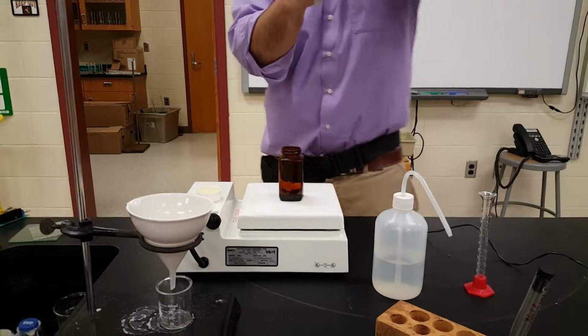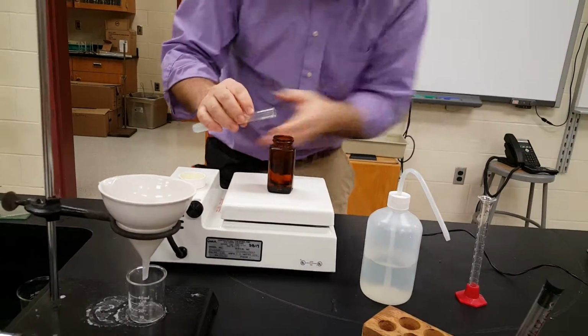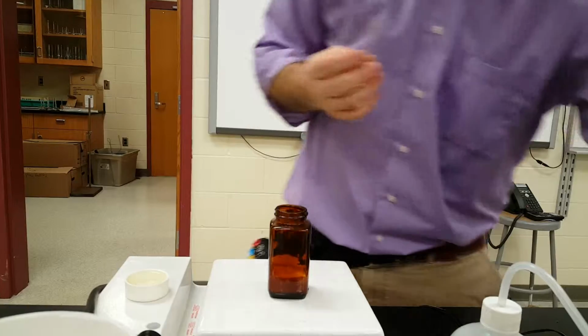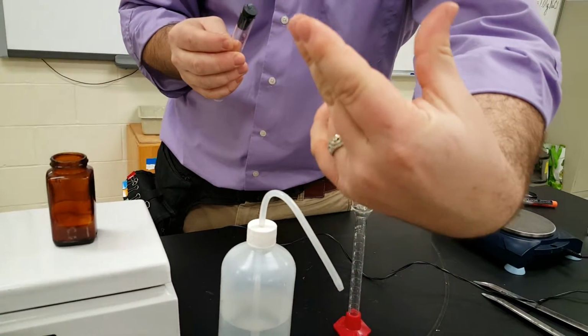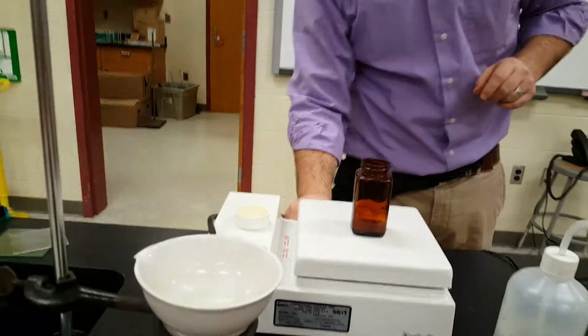Okay, and then I'm going to add our silver nitrate, aqueous, to the same reaction. Don't get any on you. Try not to get any on me, because it will react with the sodium chloride in my skin, and I'm guaranteeing you I just got some on me. Nice. So maybe in a few minutes we'll see my fingers turn black, or in tomorrow morning's video when it's dried up, I bet you my fingers will have turned black.